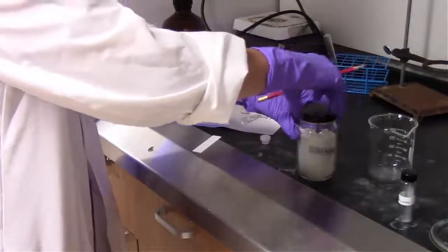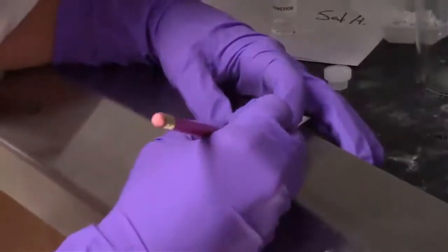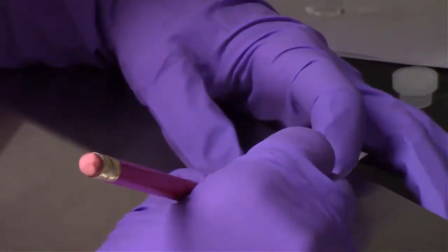So when you draw your very, very faint lines on that and then spot your compounds on the plate, you definitely want to be on the silica gel side. So not the shiny plastic side, but the side where the silica gel is adhering to that plastic backbone of it. So it looks like we've labeled, we've got caffeine on the left, caffeine salicylic acid mixture in the middle, and salicylic acid on the right.